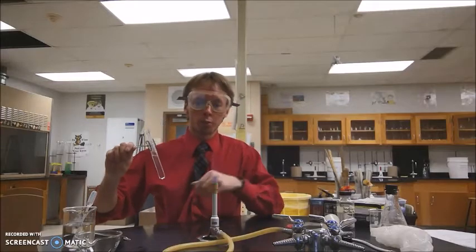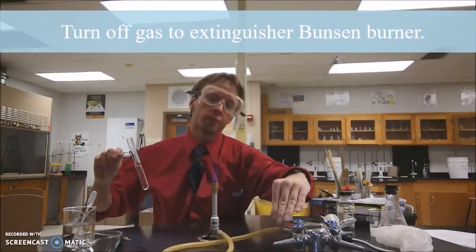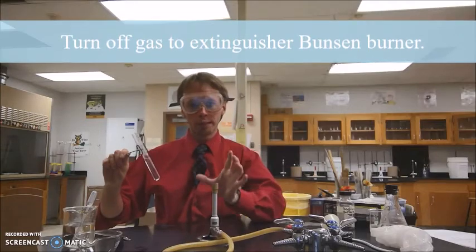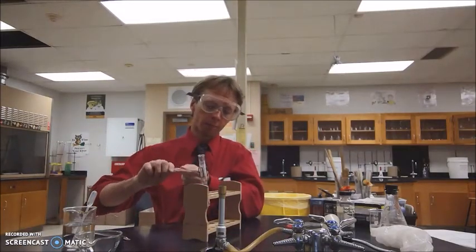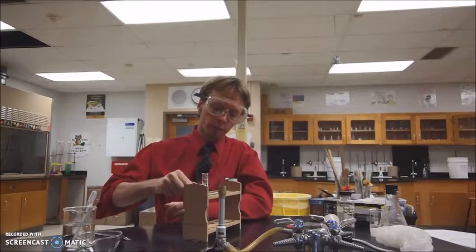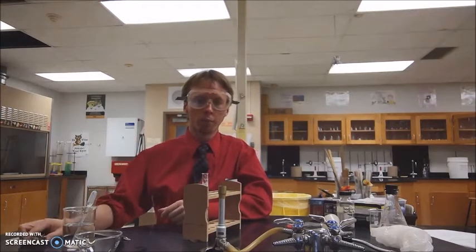Make sure you're securely holding your test tube holder, because when this starts to boil, it does jump around a little bit. Now that my sodium sulfate is completely dissolved, it took less than a minute. What I'm going to do is I'm going to turn off my gas line to my Bunsen burner. We will need the Bunsen burner later, but right now, while we're doing other stuff, we're going to have it off. And what you'll do is you'll take your test tube rack and put the test tube in there, and then release the test tube holder.